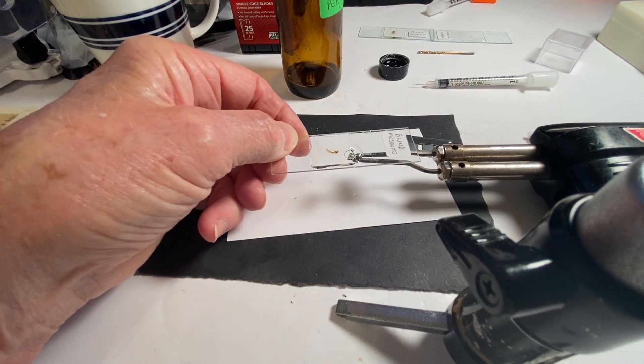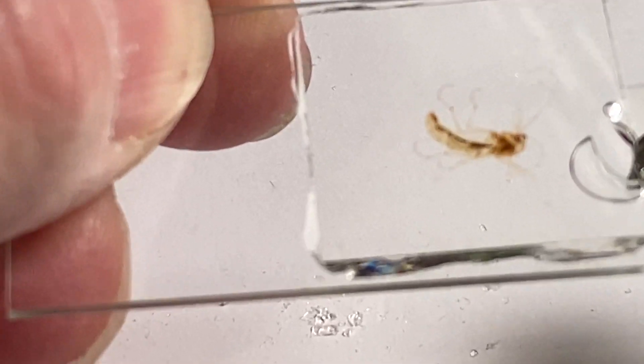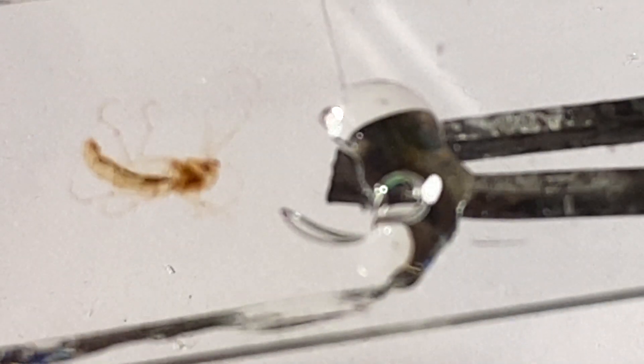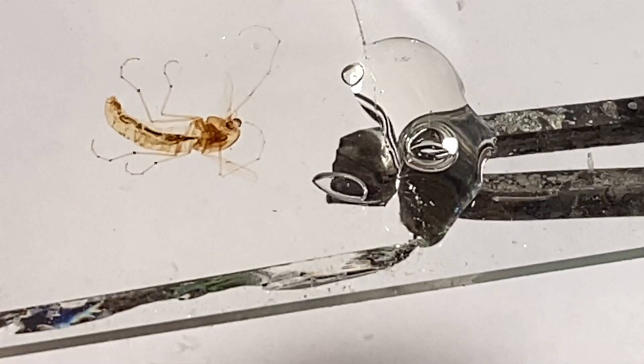Now I'm going to reduce the magnification and take my soldering iron. Let me increase that magnification again — I apologize, I'm a one-man operation. Oh look, it's filling up on its own! It proved me wrong. Now we have a bubble that's inside. How do we get that bubble out? I'm going to turn some heat on. Make sure the soldering tip is between the bubble and the edge of the slide, because you want to melt or reliquify the mounting medium. Look at that — that bubble is moving on its own!